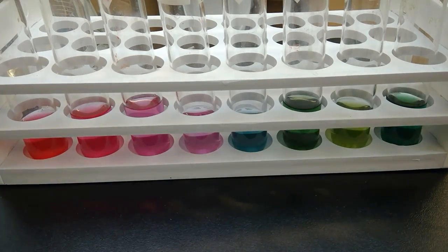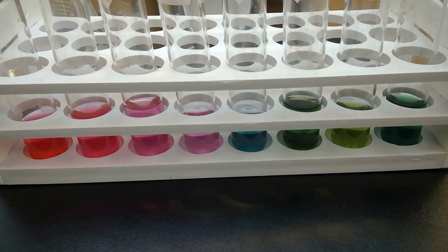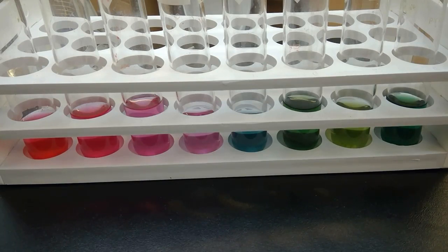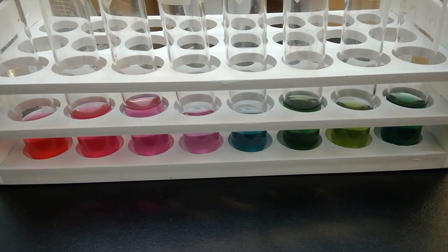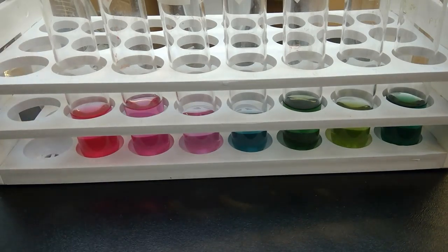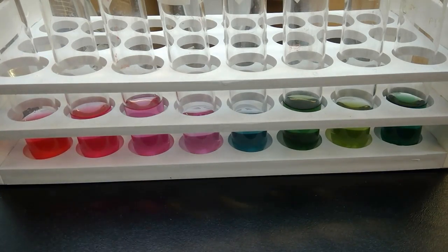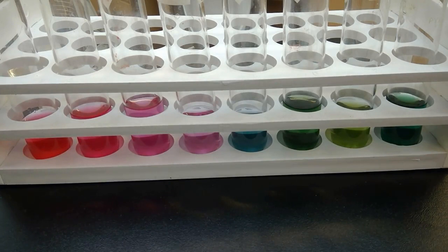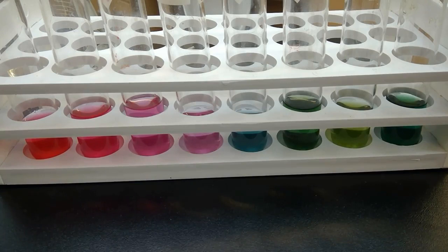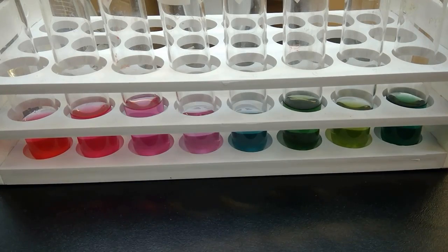Any questions on what we're using this for? Here's what we're going to do. With your tablemates, you're going to get three test tubes of the same size. You get a test tube rack — there are a bunch floating around. You find a rack, and you're going to go around the room and find a solution whose pH you do not know.